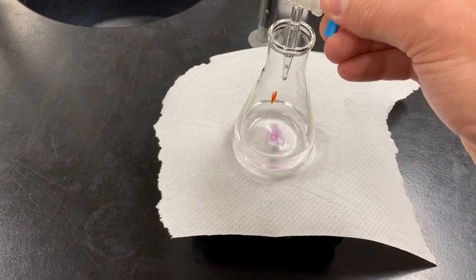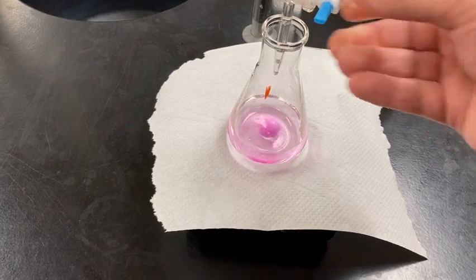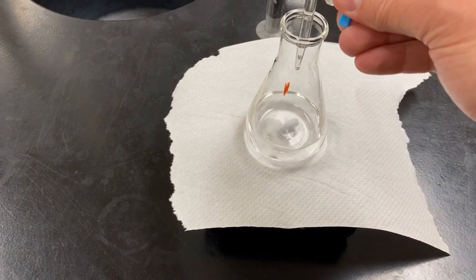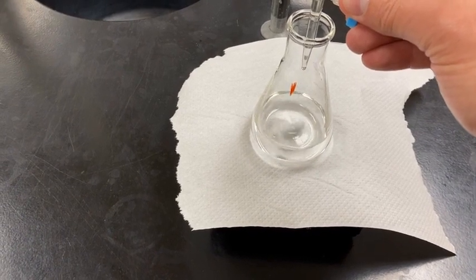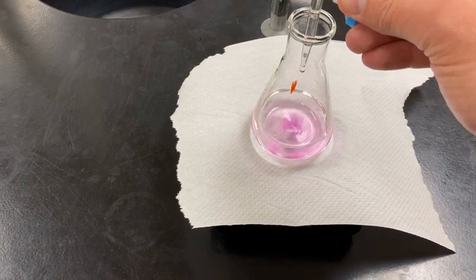Disappearing, so we're going to add a little bit more. The excitement of it all. Here it is. I'm thinking a couple more drops. We'll see. Over or under, guys? Ooh.